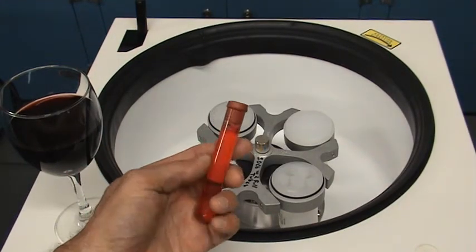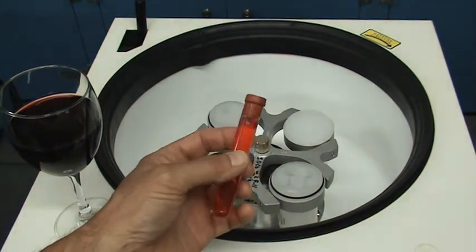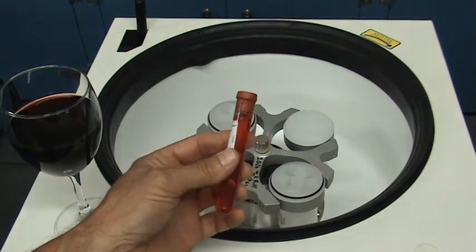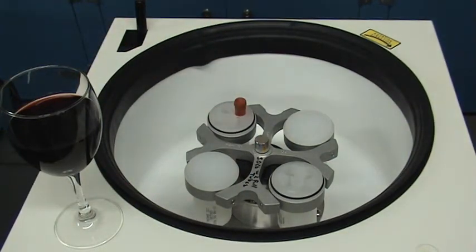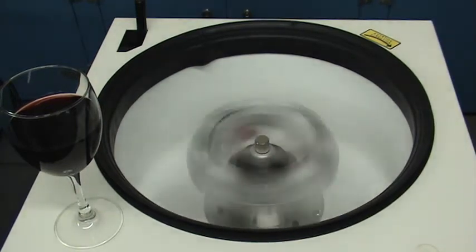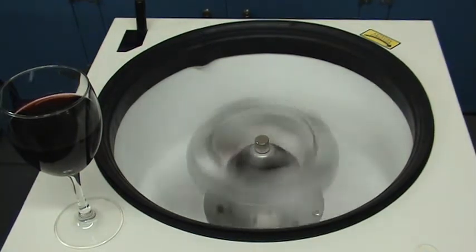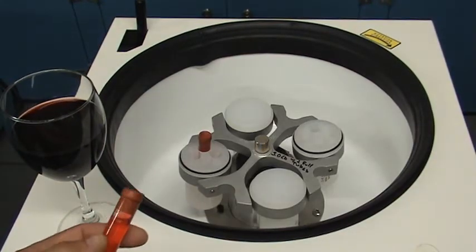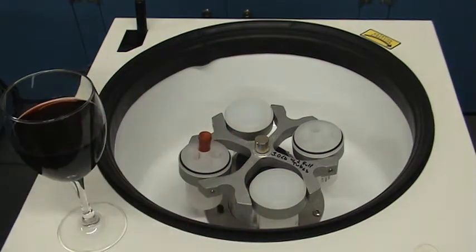Next, we'll show that we can now operate quite smoothly with the same very full 10 ml specimen tube that formerly would not work in the standard thermo system. Next, we'll push the technology considerably by installing a second full 10 ml tube into the rotor.